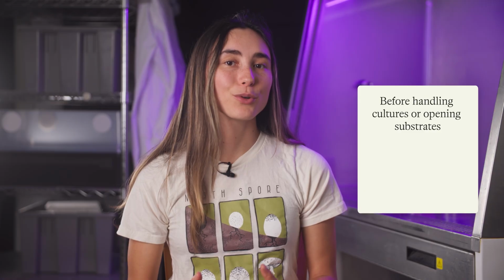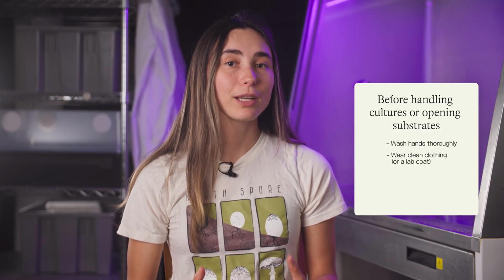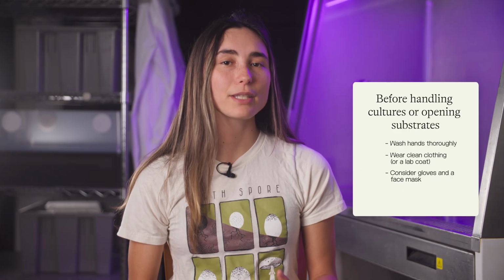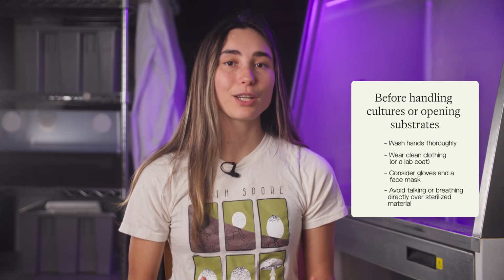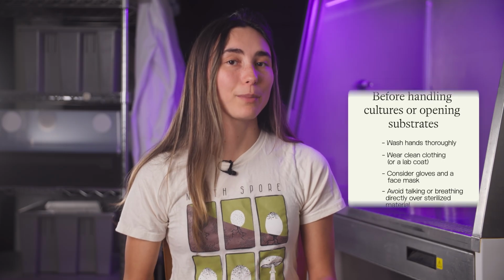Before handling cultures or opening substrates, always wash hands thoroughly, wear clean clothing or a lab coat, and consider gloves and a face mask. Avoid talking or breathing directly over sterilized material. Even droplets from your mouth can introduce contaminants.